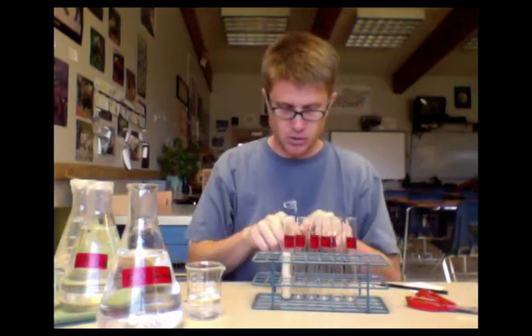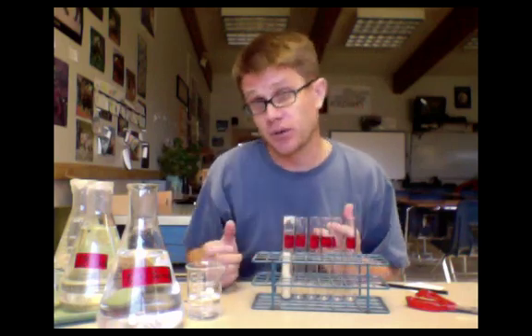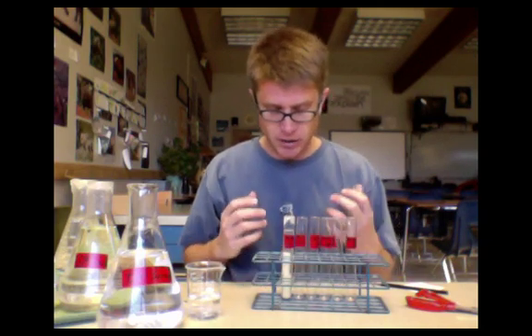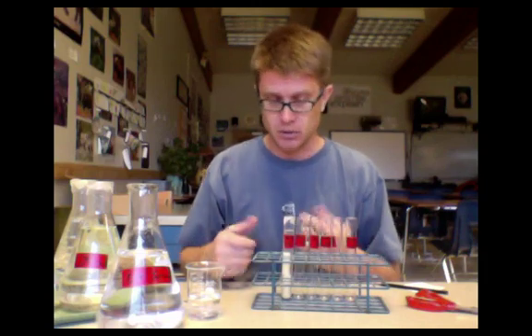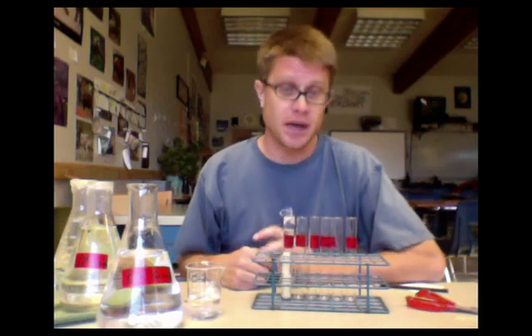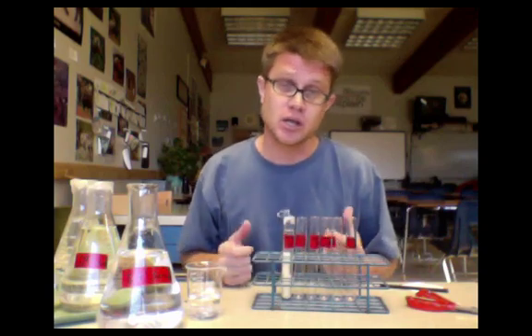We'll go through all the other ones. Remember you're going to put a different sucrose solution in each of those. After we've got their mass today we're just going to wait 24 hours. After 24 hours we're going to dump out the water and remass each of those potato cores. This lab is super easy. You'll always get perfect data as long as you don't mix up which of the potato cores is which.